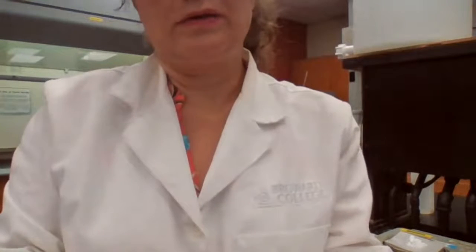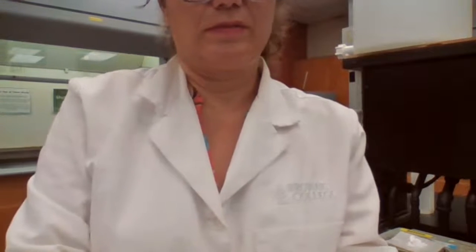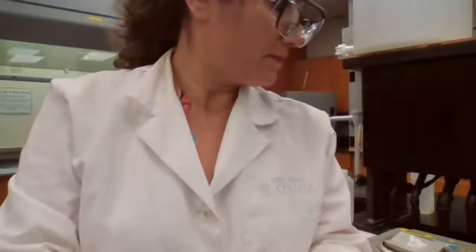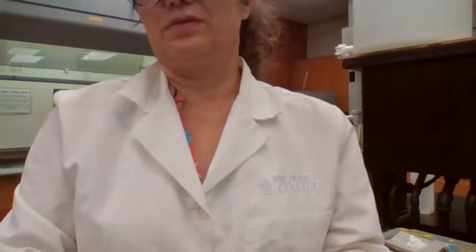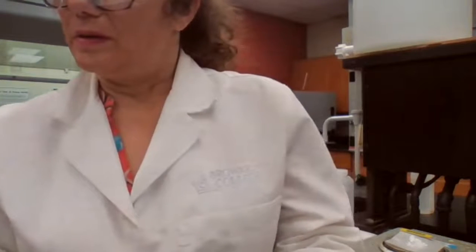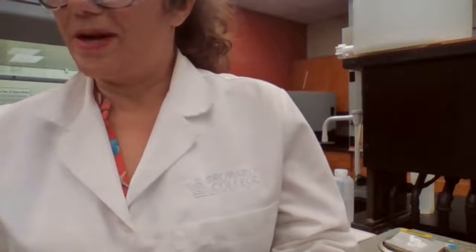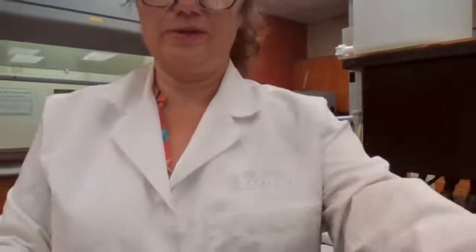Sorry, 2.848. 2.848 gram is station 12. So you have the chemical formula, you have the mass, you can find the molar mass using the chemical formula, then you can find the moles.